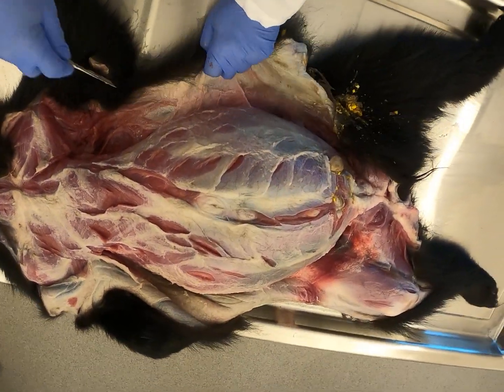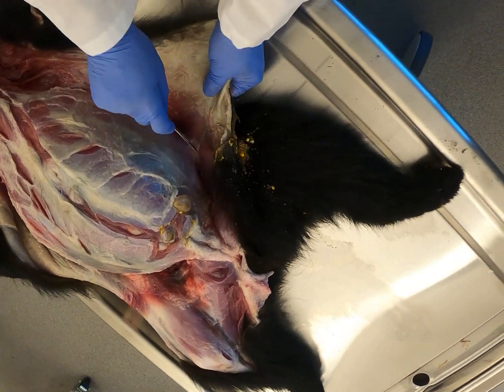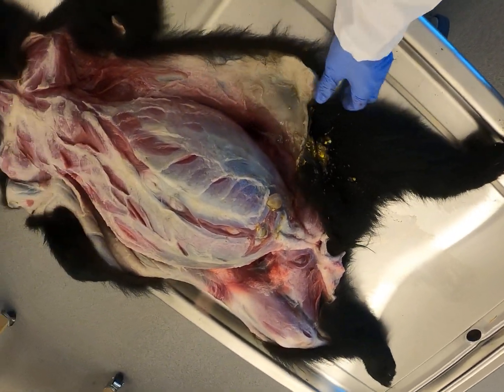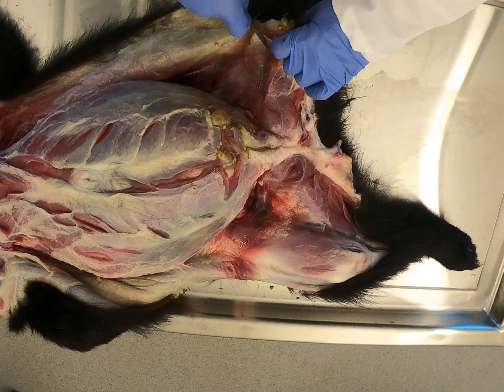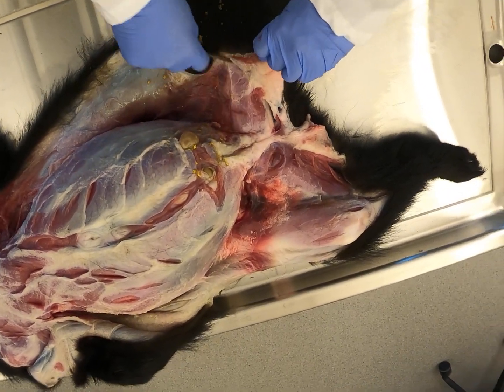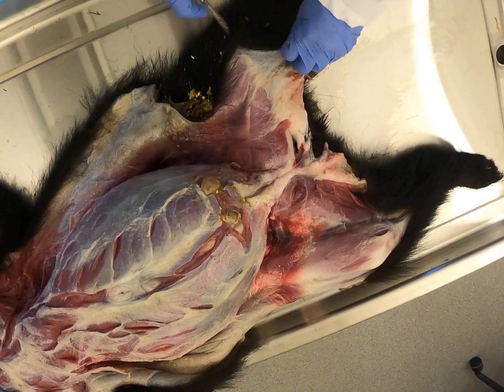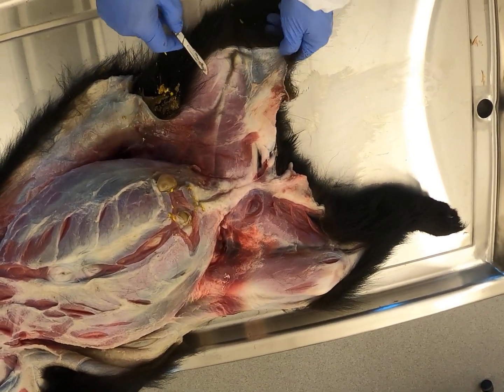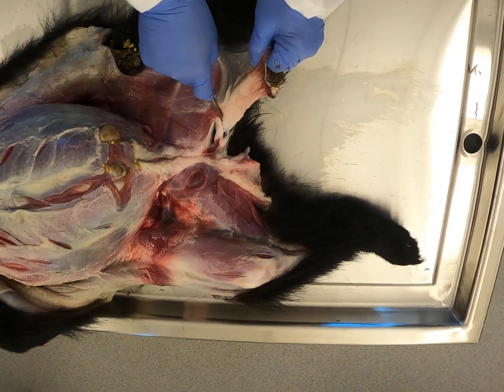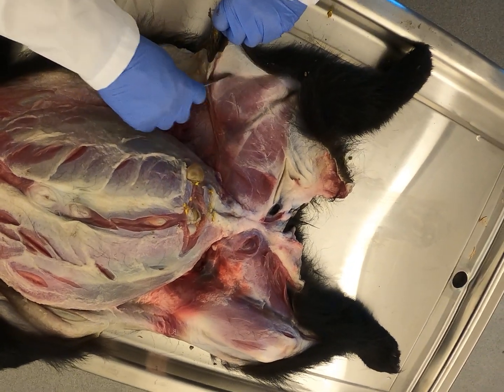You can see how the belly is distended from bloating. I wasn't really confident what to do with it when I had it at home — whether to open it up and let that gas out or not. I'm glad I did it earlier; I don't think we would have wanted to be releasing that gas now. You wouldn't mind because you're not here, but I would certainly mind.